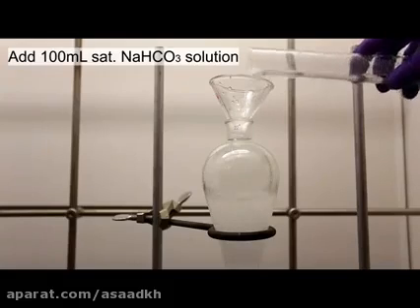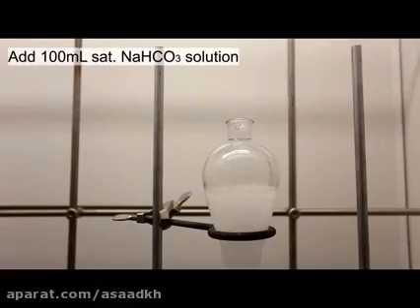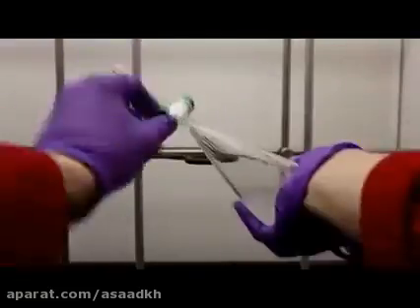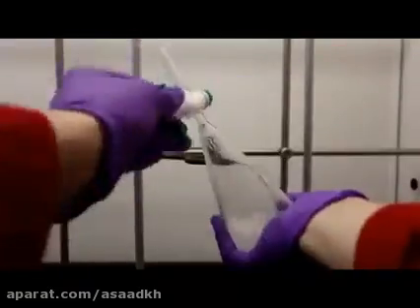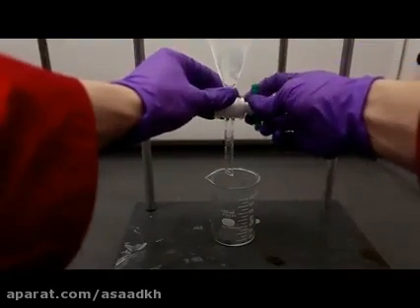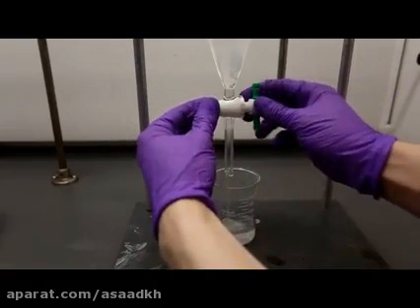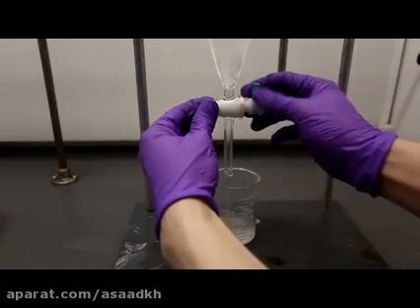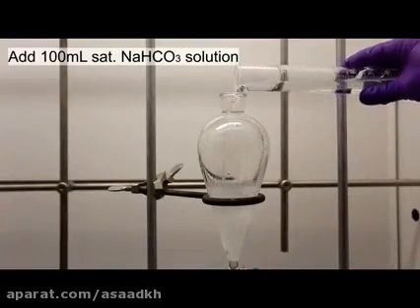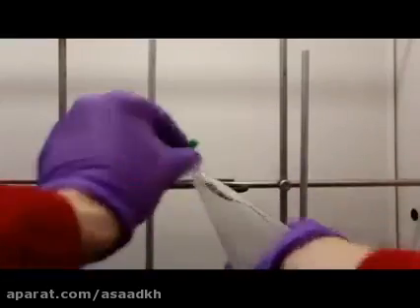So before proceeding ahead to capping and shaking the separatory funnel, be sure to allow the reaction to calm down a little. Once the reaction becomes less vigorous, the separatory funnel is again capped and shaken vigorously with frequent venting. The layers are allowed to separate, and again the bottom aqueous layer is drained and removed. Be aware that at this point the aqueous layer and the organic layer might be a little bit cloudy, but that's fine. Again, the pentyl acetate is washed with 100 milliliters of saturated sodium bicarbonate solution, shaken, and the aqueous layer is discarded.